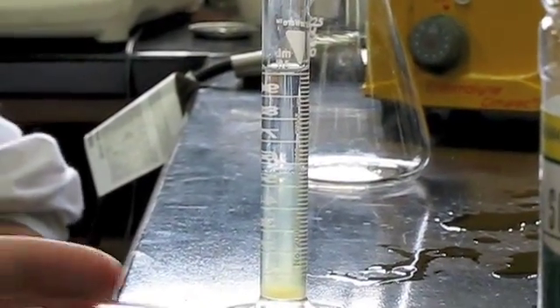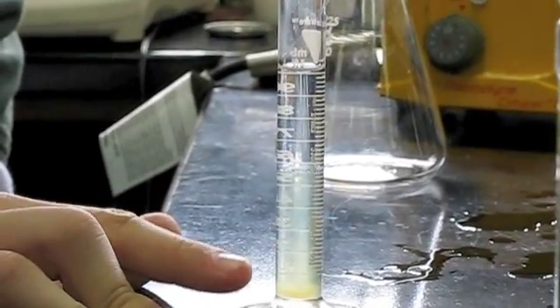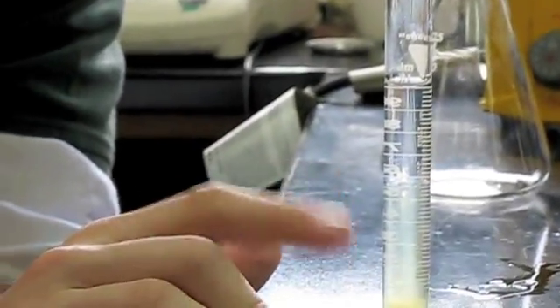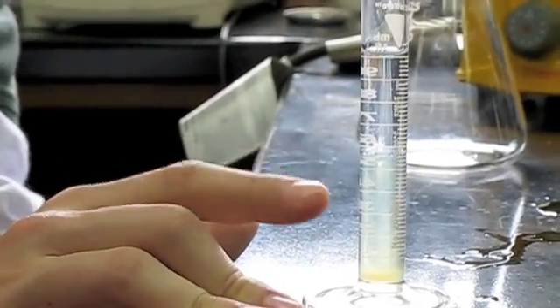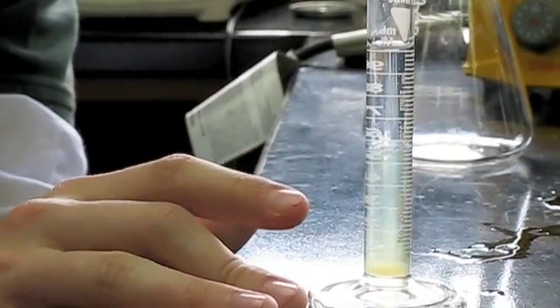Here we are looking at our experiment. There's protease from pineapple juice in the bottom and then we've got our extracting mixture, which was made out of detergent, salt, distilled water and we have banana mashed up in there.